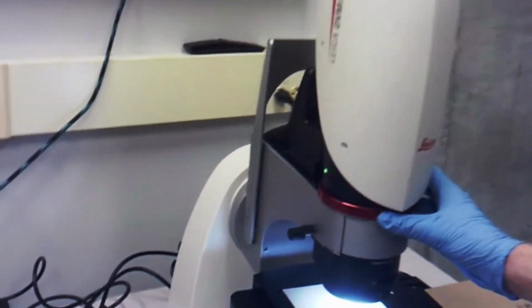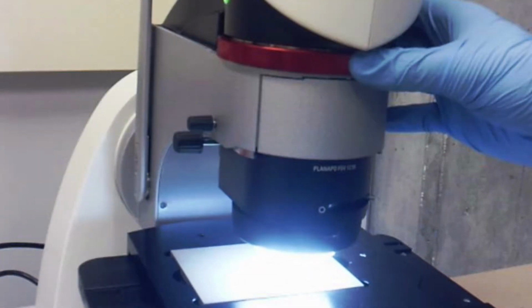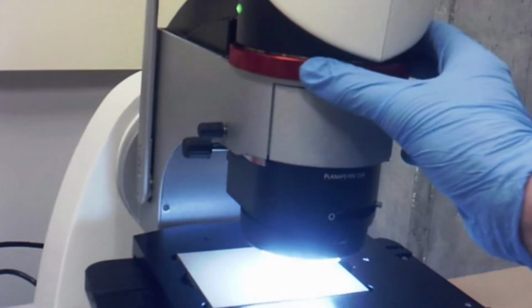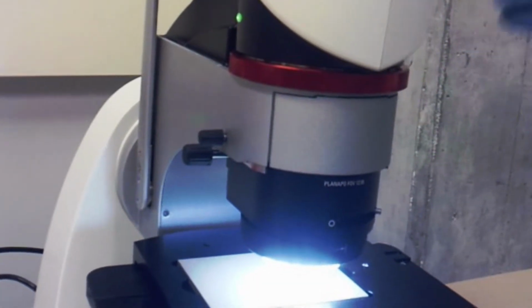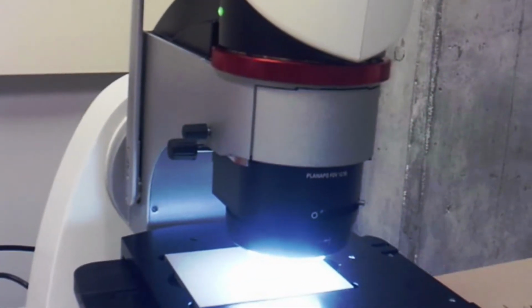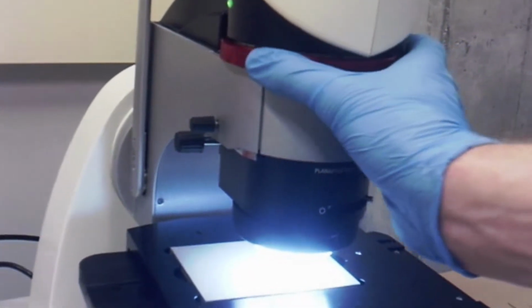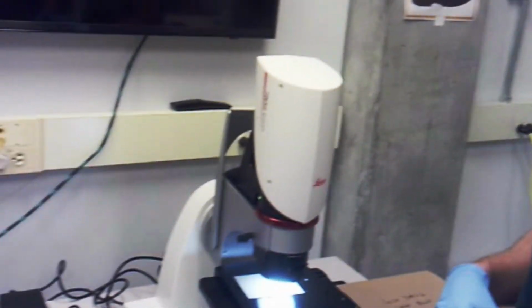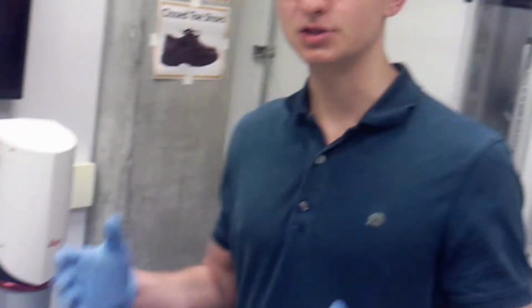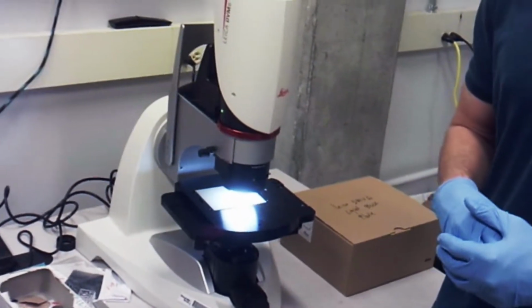The last piece of interest here is, of course, the magnification ring. This is this big red ring here. You can rotate it either counterclockwise or clockwise to increase or decrease your magnification. This is one of the few features that cannot be changed in the software. You have to change the magnification on the microscope itself. But it's simple enough as just changing this dial and rotating it around. But that's the primary features of the knobs and dials thus far.